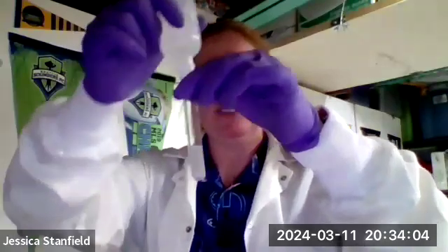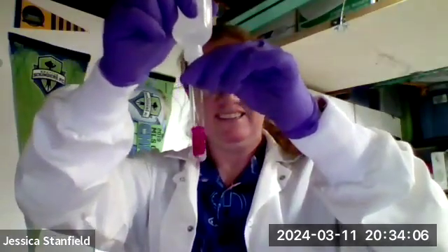All right. Oh, still need to add some more. Got it yet? Almost there. Oh, not quite. It went away again. Let's add a little bit more. All right, there we go. Now it's not going away.